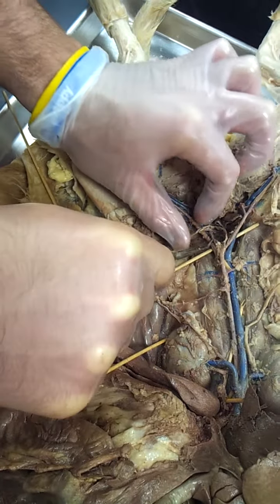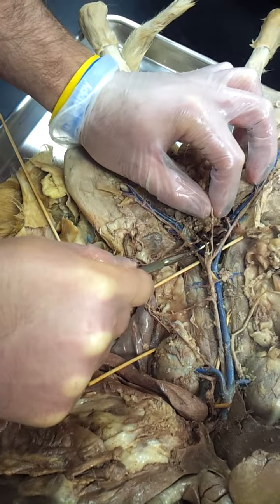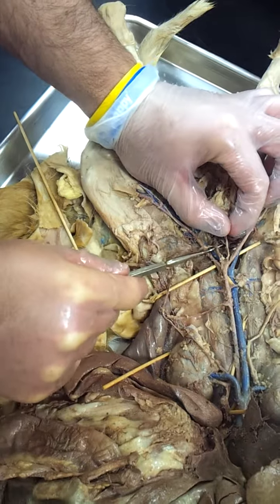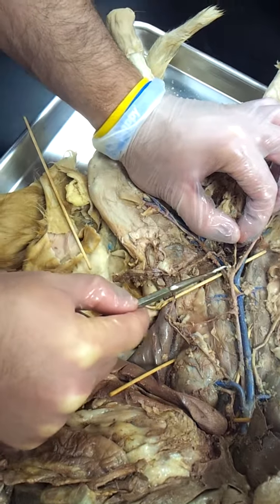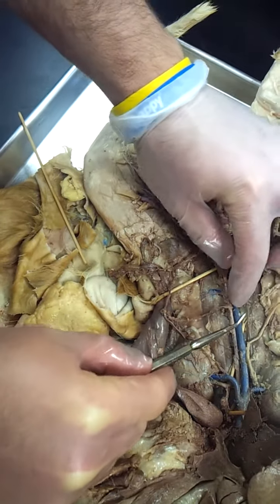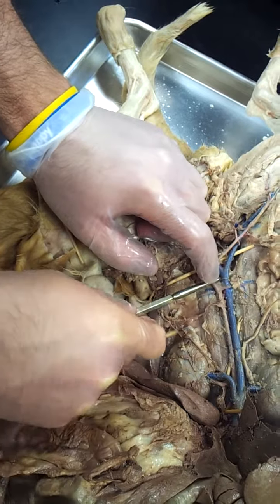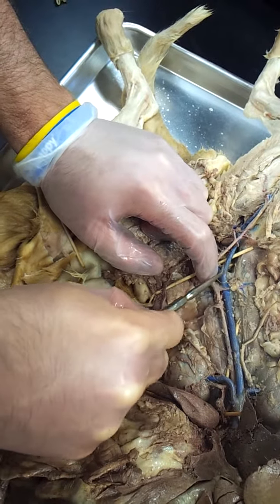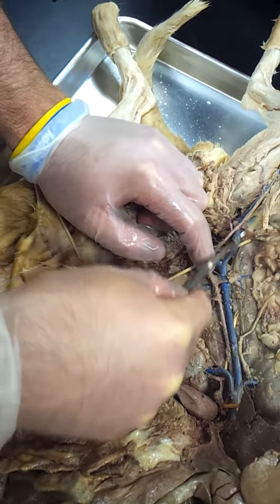And you can see a little bit of, is that the middle sacral? You can see the internals. So you can see two nice internals set up there. We don't really have a common here. The area is so small that you don't have to worry about it. So just external, internal. As we pull that out of the way, you can see that IVC again branching down into, just worry about the externals here. I've chopped off the internals.